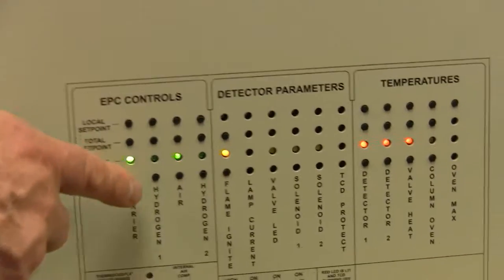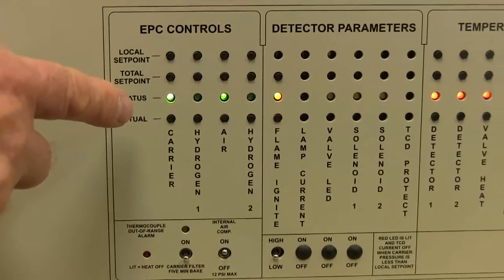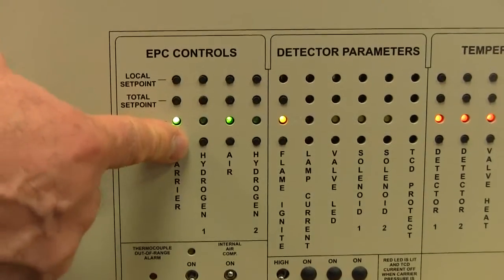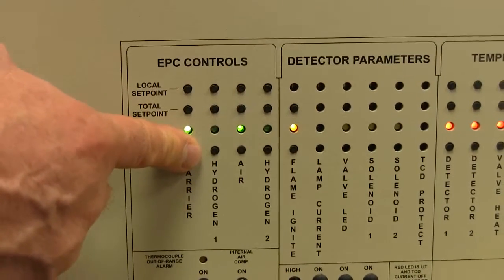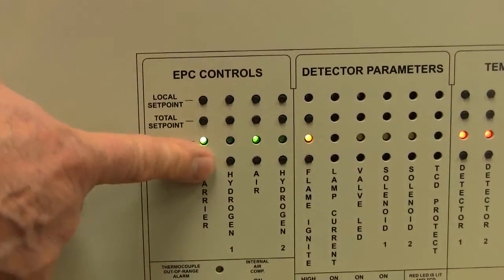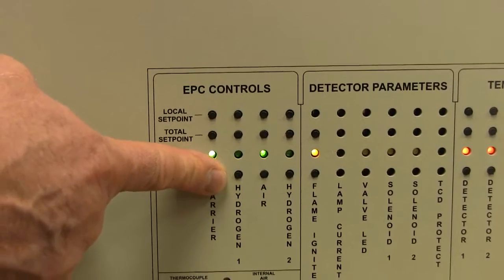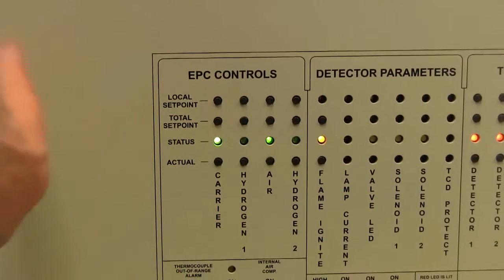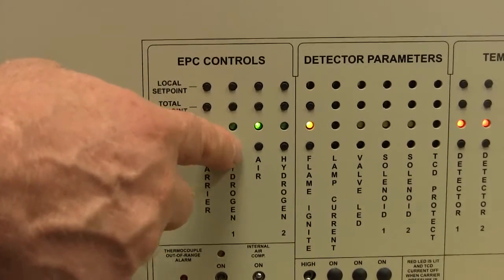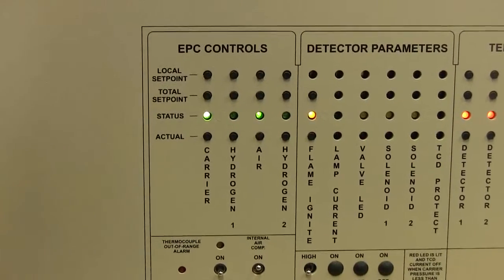And also, we need to have a source of hydrogen in order to make the flame light. So the hydrogen can either be from the carrier gas, as it is in this particular GC, where the carrier gas is set to a pressure that goes through the column and then into the FID detector, and that's really all the hydrogen the detector needs. It does not necessarily need any extra hydrogen from the makeup hydrogen, but if you're using helium or nitrogen carrier gas or argon, then you might need to supply hydrogen. So check the hydrogen reading and make sure that you have hydrogen also going to the FID detector.